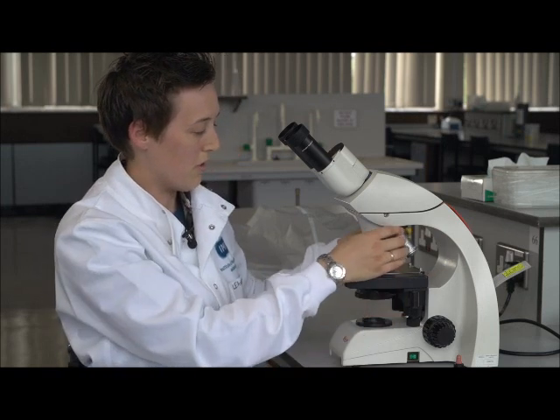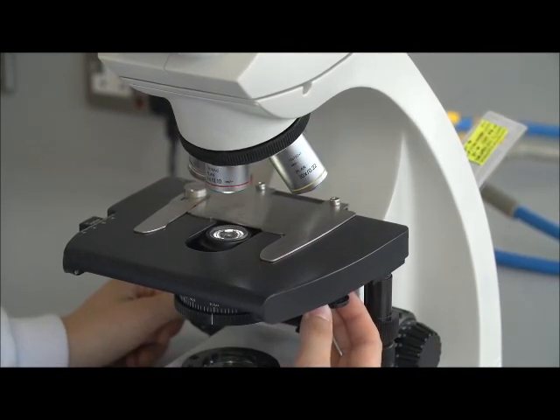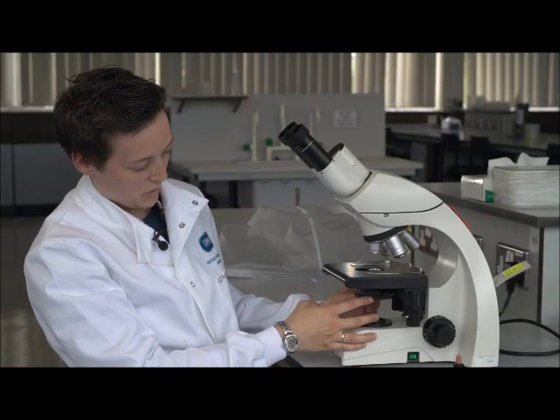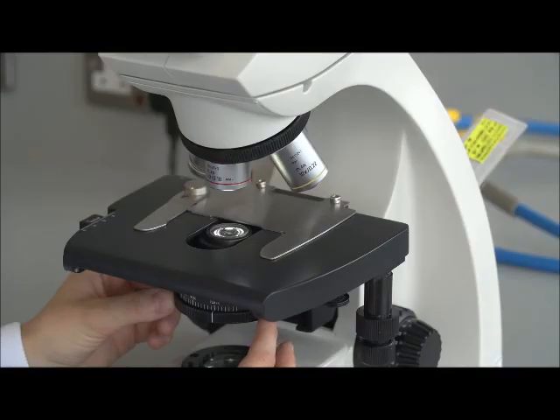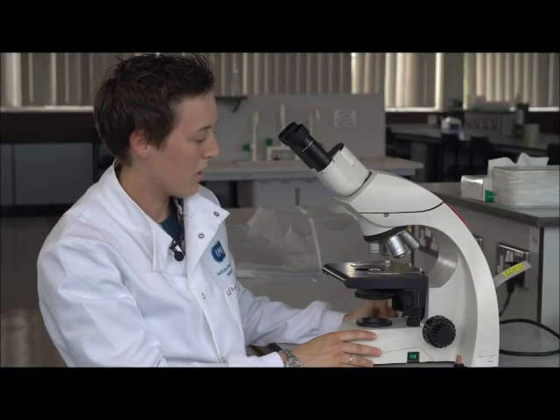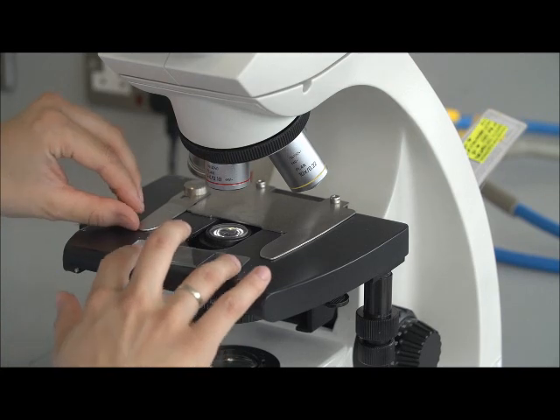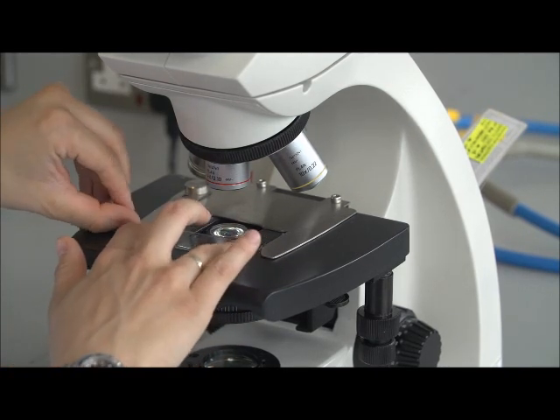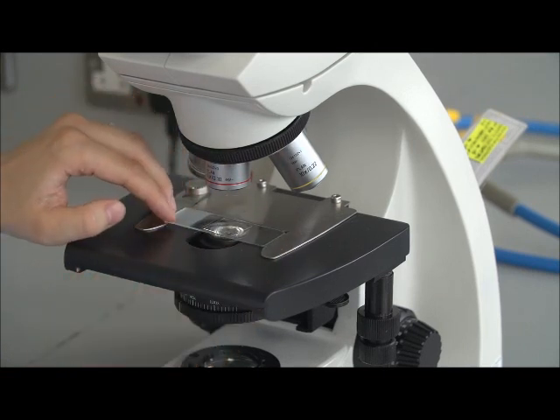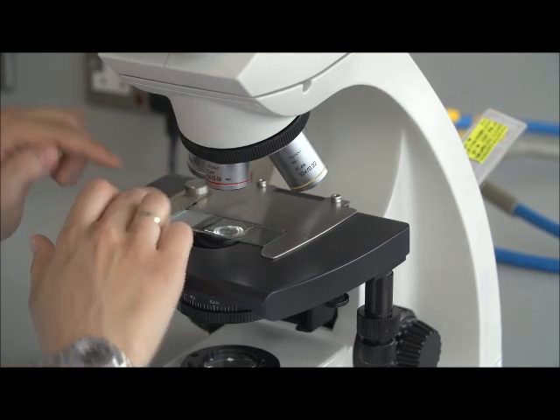Another common mistake is that the phase ring is in when it shouldn't be. For instance, on the lower objectives. So on the 4 times and the 10 times, this phase ring should be out. One other problem can be that the iris diaphragm underneath is turned down too low or too high, meaning that the light levels aren't correct for you to be able to see your specimen. And finally, one last problem can be that the slide isn't held in position correctly. Sometimes it can be wedged underneath, and sometimes it can be raised on one side because it's not being held in and it's actually on top of the holder rather than being held in by it. And these are just a few common mistakes that you can look out for when you're using the microscope.